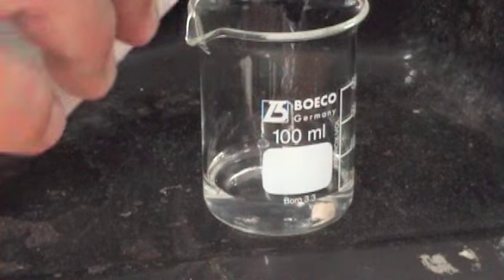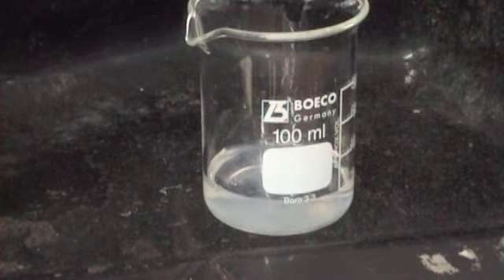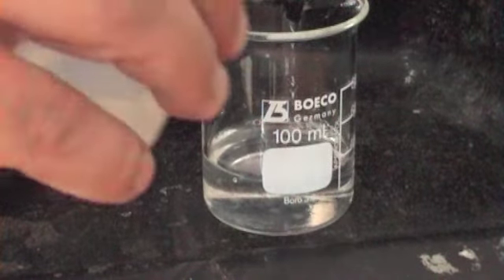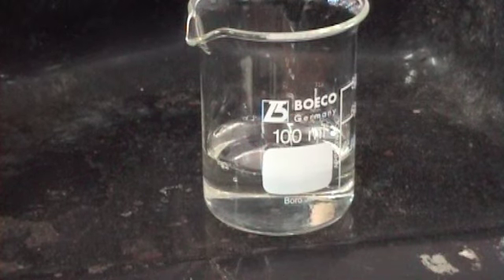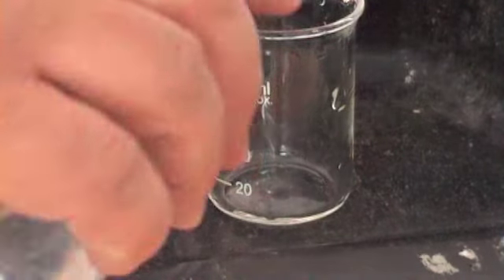Okay, first of all, sodium hydroxide, okay, and we get, okay, white precipitate in there. If I add in more, okay, just about redissolved, better confirm it, a bit more, there we go, redissolved. Redissolves because it forms a complex ion, yeah? Yep. 4 hydroxides around the zinc, okay? Alright, new sample, so now we know it's either zinc or aluminium or lead.